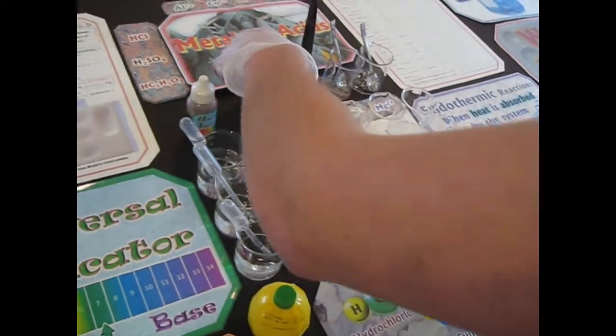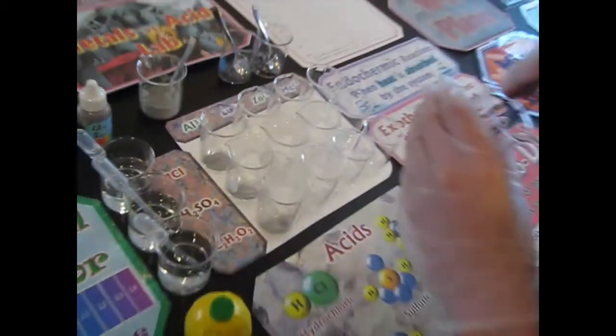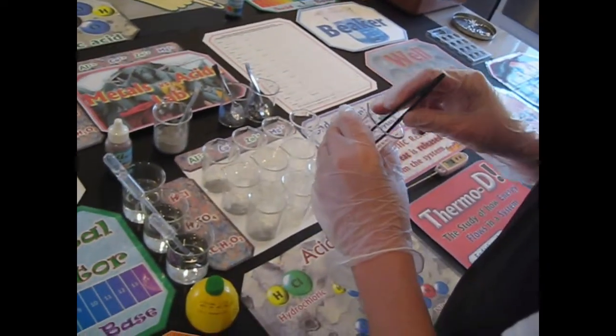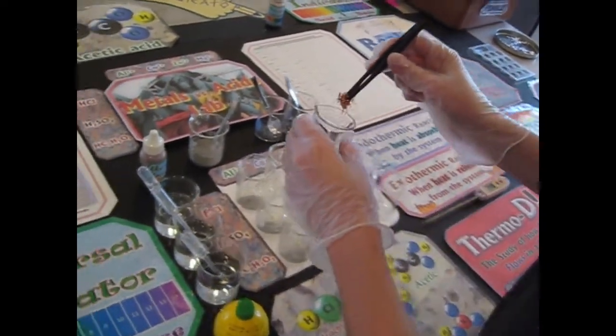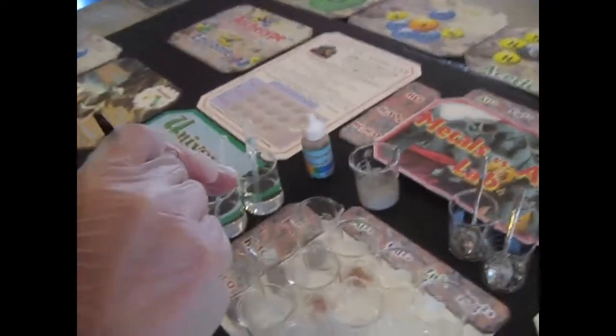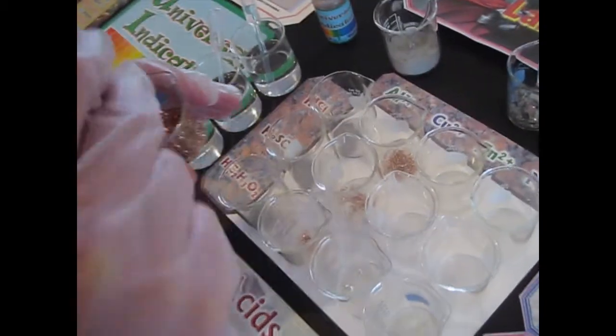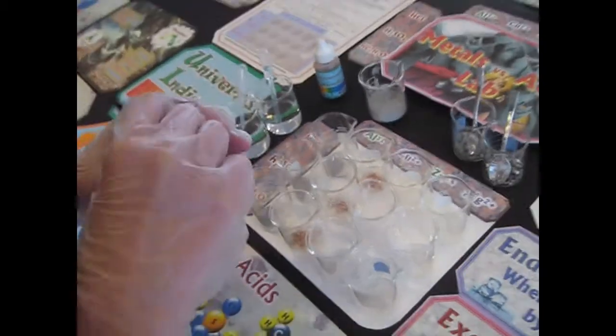Okay, that's the Al. The next one is, do you know what that one stands for? Copper. Copper, good. Cu, cupros, or cuprum. It's from the island of Cyprus, where they used to excavate it in the ancient world. I'm going to come on this side to see better. So we've got aluminum in the first column. We've got copper in the second column.